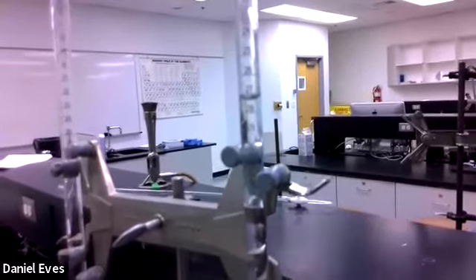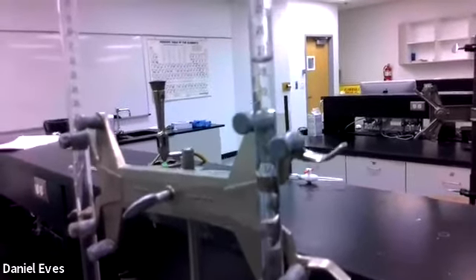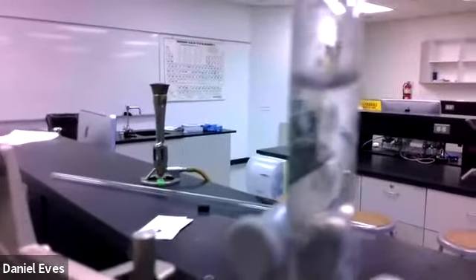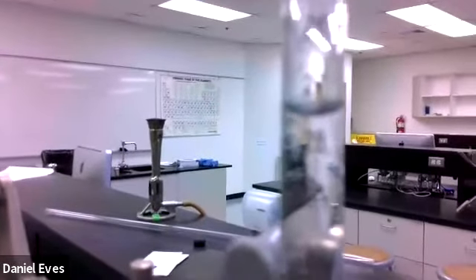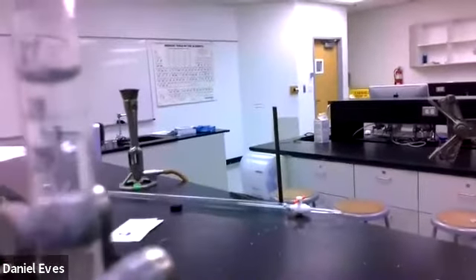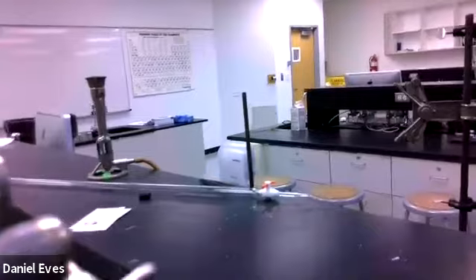Looks like we are at 27, and I don't know if you can read the meniscus as well as I can, so I'm going to try and, yeah, it doesn't focus as well as I would like it to. But I could tell you that it is at 27 and halfway between the 1 and the 2. So I would say 27.15 milliliters are what I dispensed to get that.